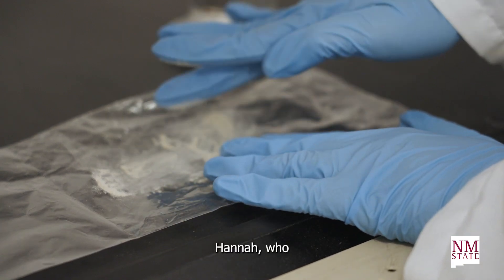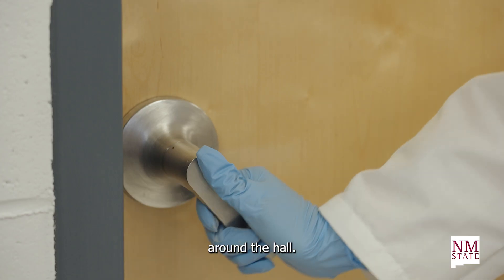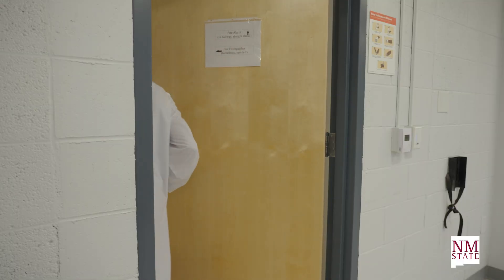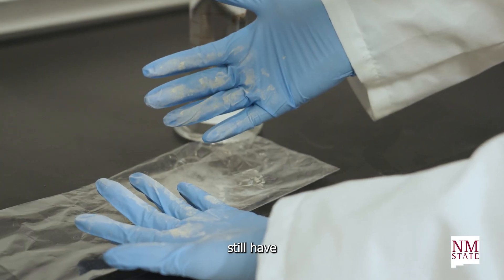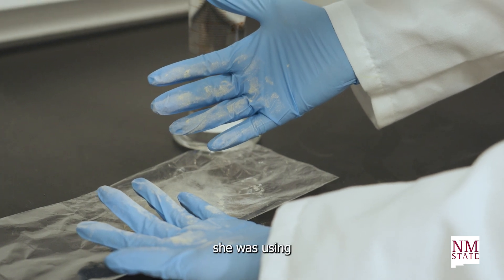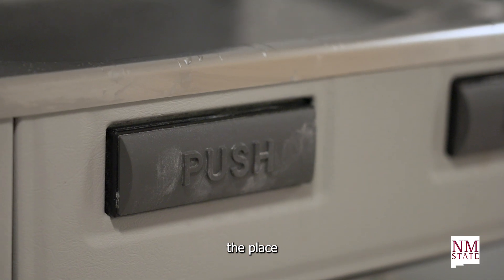Here we have Hannah, who just finished working with substances in her lab and is now walking around the hall. As you can see, her gloves still have some of the substances she was using and she is leaving particles all over the place.